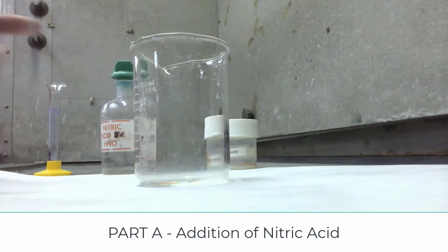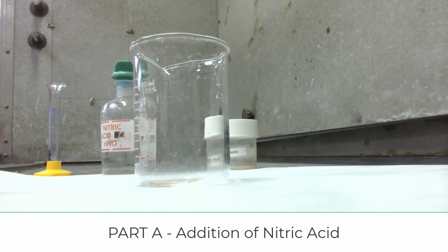Now I'm going to add concentrated nitric acid. Concentrated nitric acid is a very nasty acid. If you get it on your skin, it will remove your skin. Your skin will turn yellow, and it'll take about 2 days, maybe 3 days for your skin to replace it. There is nothing you can do, and so don't get it on your skin.